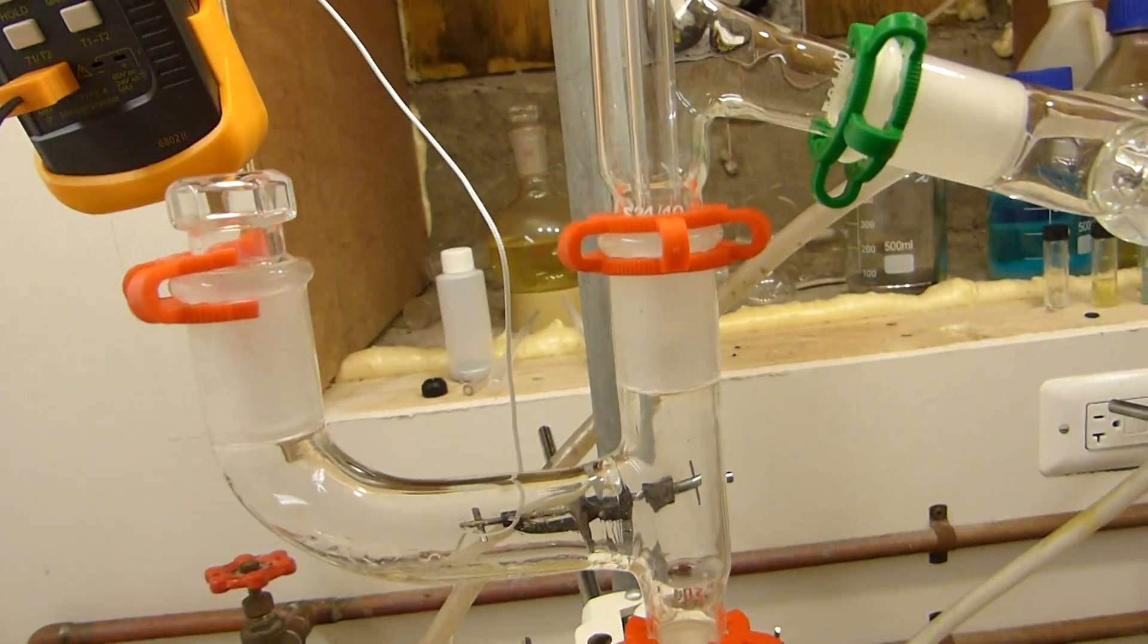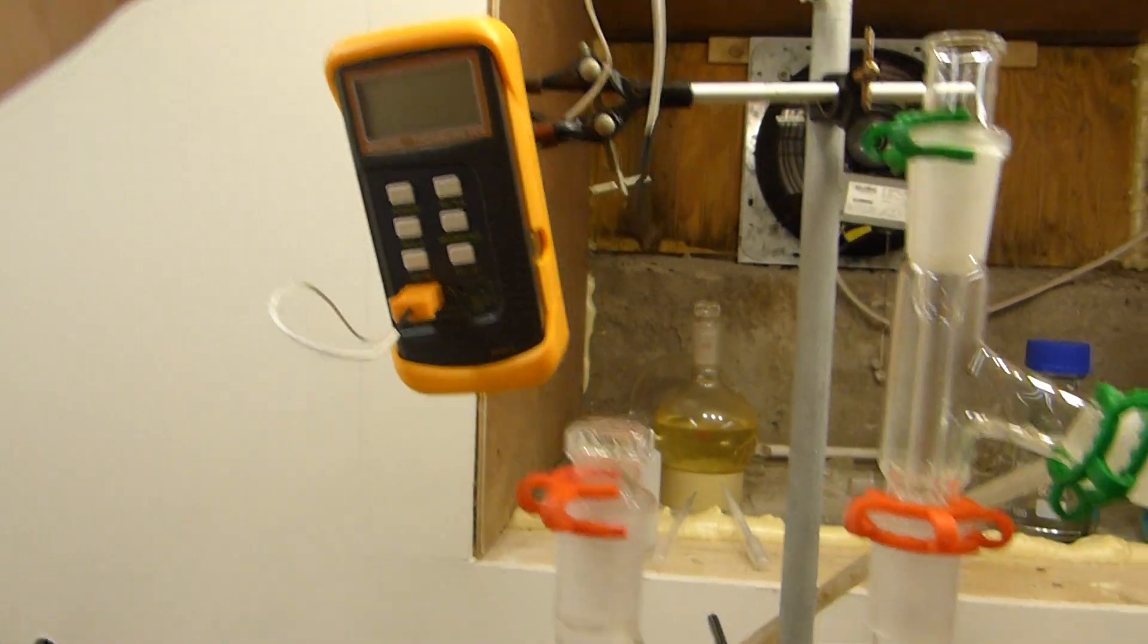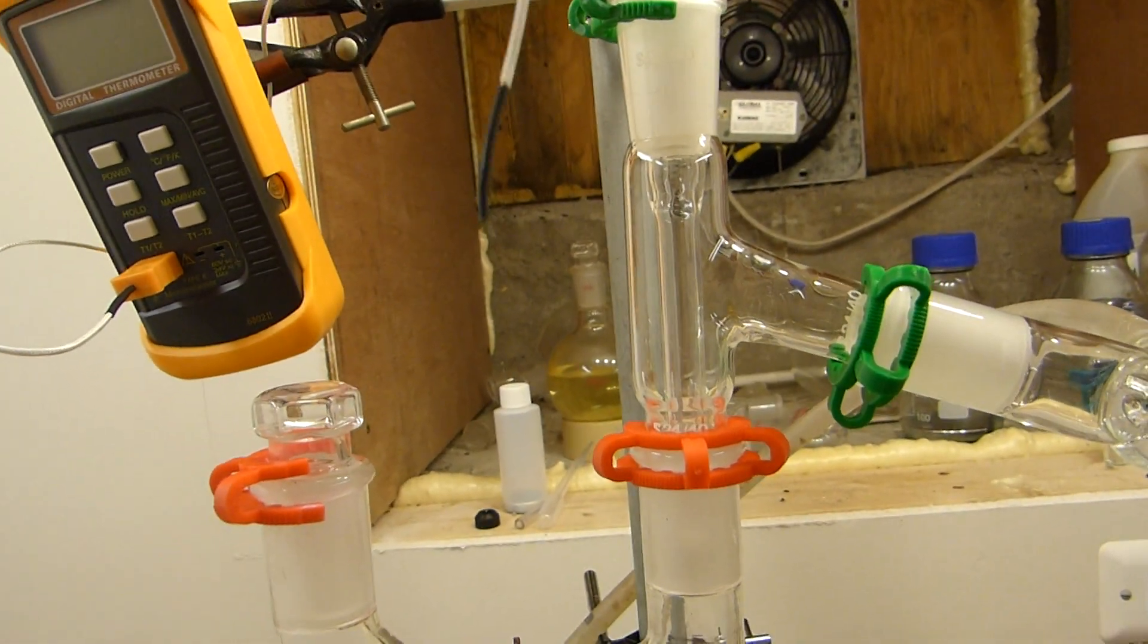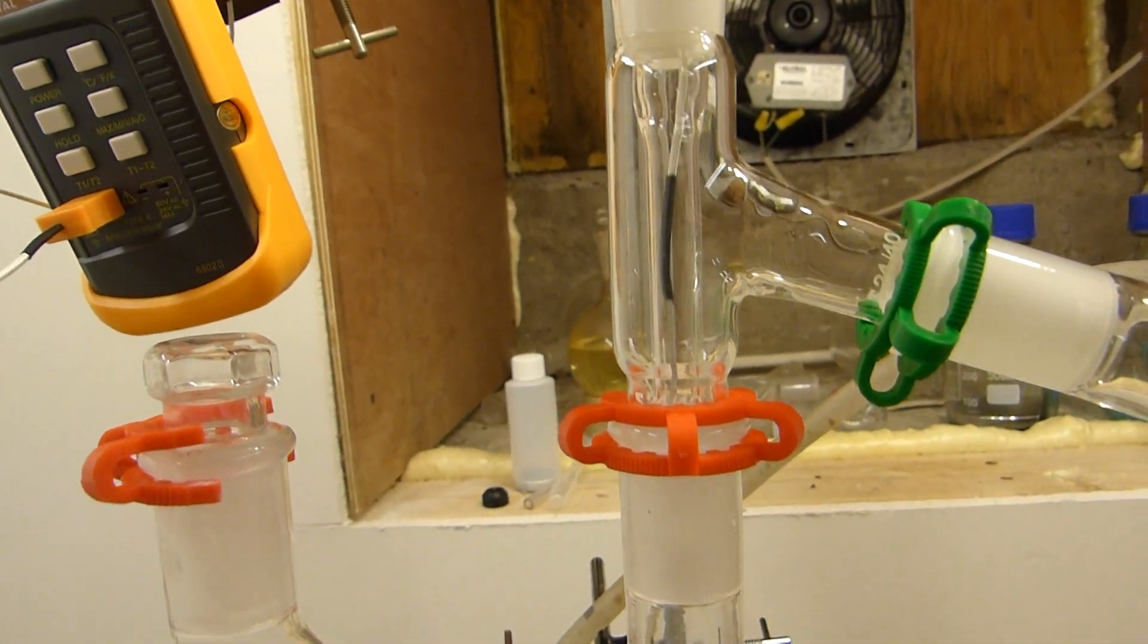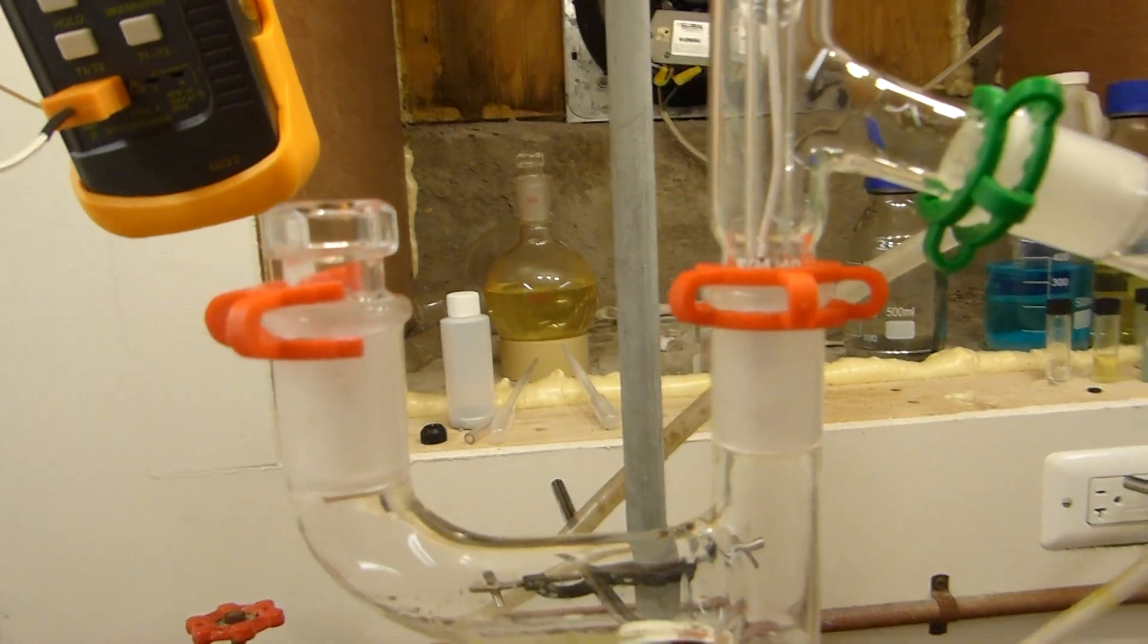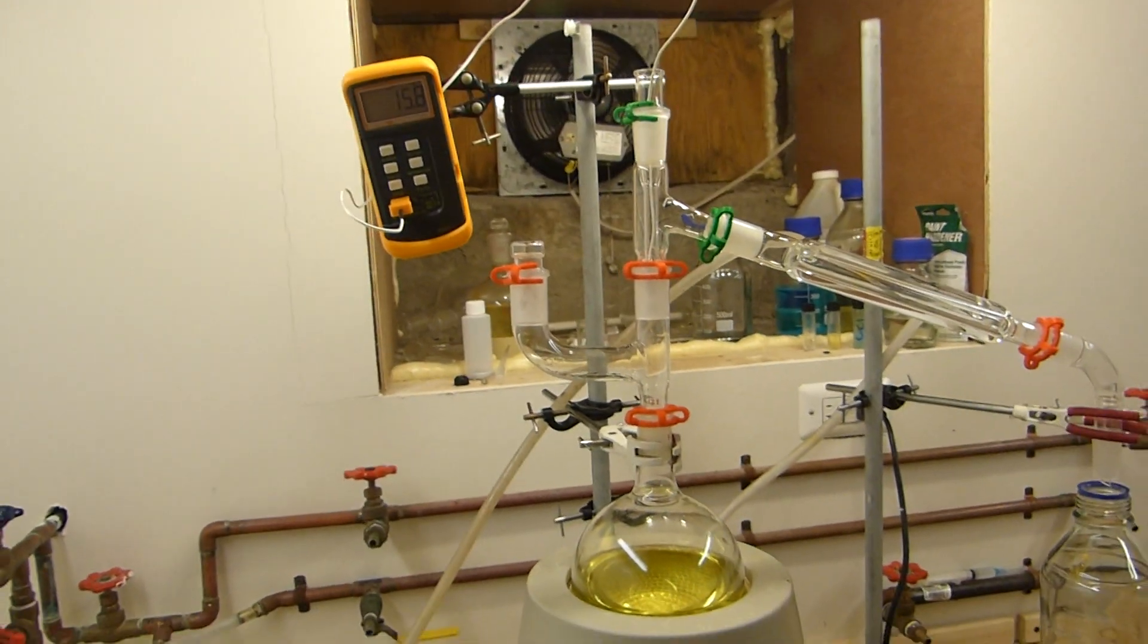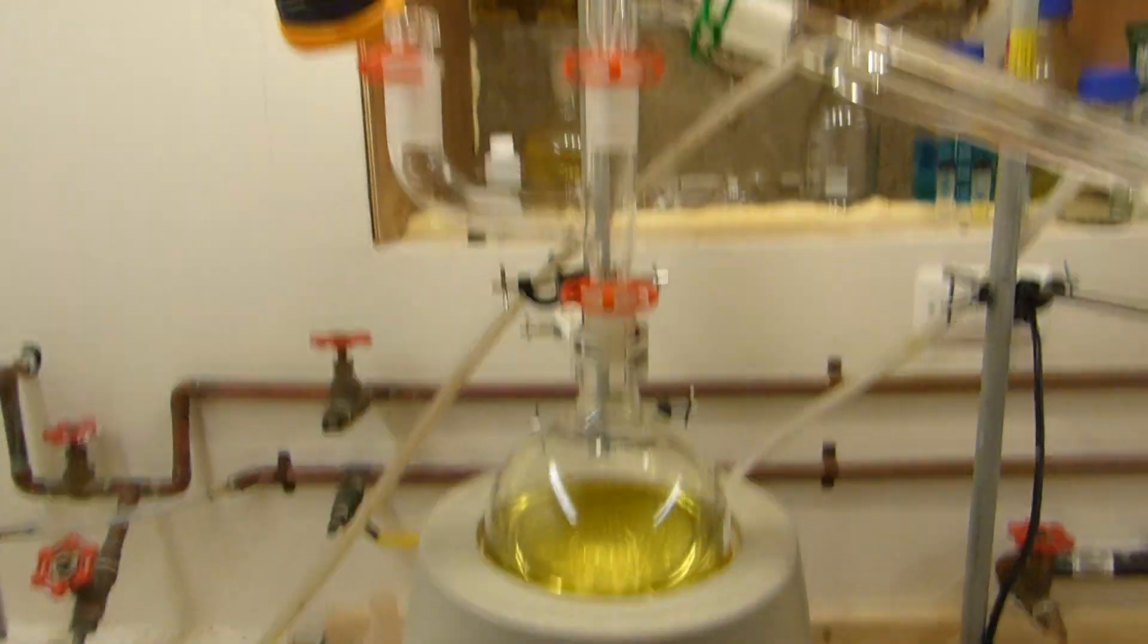And what I use is, even though I have a lot of thermometers, sometimes they're hard to read. So I have this digital thermocouple probe and a Type K thermocouple here, which is accurate to pretty much 2 degrees C. So as long as you're not doing fractional distillation, this works out well. Also, it'd probably work for fractional distillation too, but you just have to calibrate it basically. Anyway, this just gets stuck down in there. It sits a little bit low and ends up sitting right about there, but it's within 2 or 3 degrees of what I want to distill and it works pretty well. So then I can simply turn it on. It'll calibrate itself for a second and then I'll be able to digitally monitor from a distance the temperature at which the distillate's coming over, which helps me do other things during long distillations. So there we go.